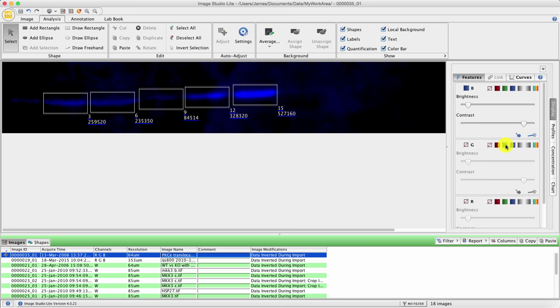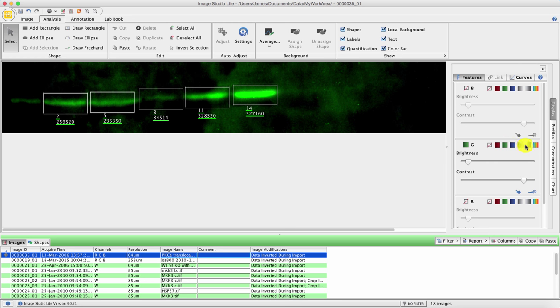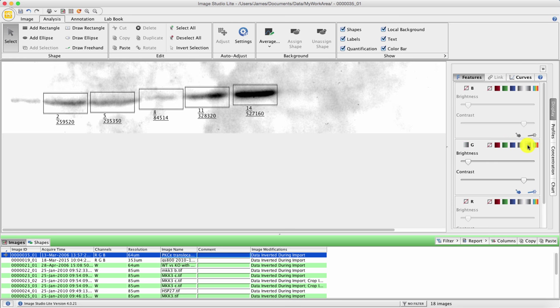It's purely visual. If you return back to the original view with all three channels showing, make blue blue, make green green, and red red, you'll see that the numbers are actually still the same. It's just a little bit higgledy-piggledy and difficult to see what's going on. So a quick recap, just click on a single channel. I'm choosing green. Click on a visually pleasing color scheme, in this case, light gray to dark gray, and then you can read the numbers off the screen, and those are the densities of your bands.